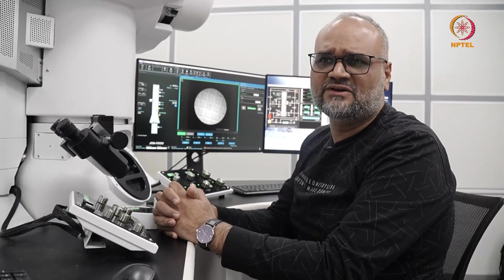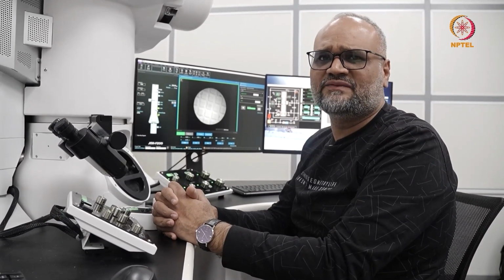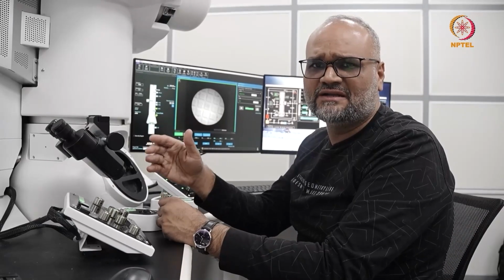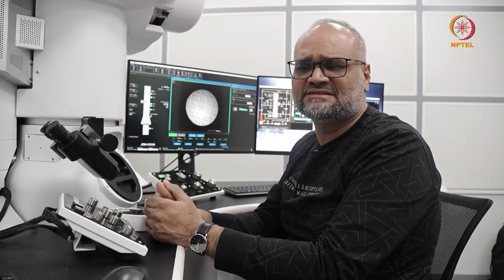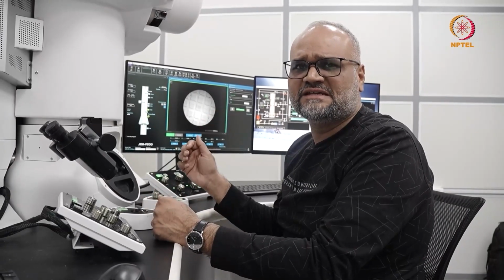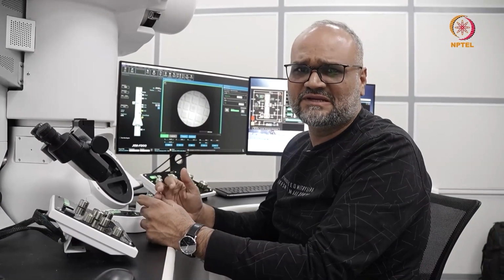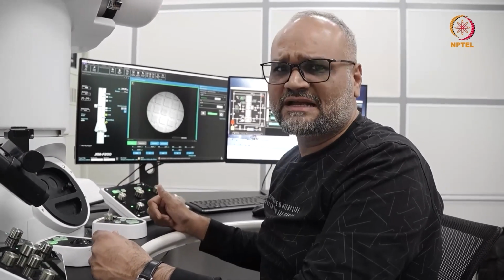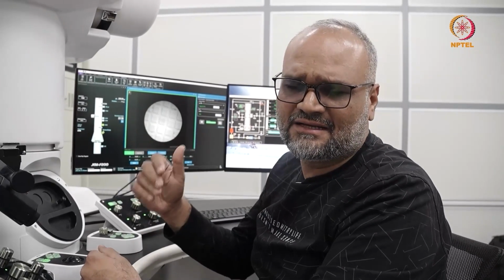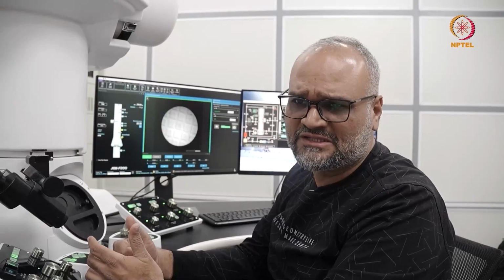I've shown you a few videos where tilting is done. You have to identify the direction of your X tilt and Y tilt, or alpha tilt and beta tilt. Orient your crystal into a low index zone axis, and then go to the amorphous area and start correcting for objective astigmatism. Also, before you do the objective stigmatism correction, you have something called the HT wobble correction, or in the Thermo Fisher microscopes, you call it the rotation center alignment. You also have the voltage centering and current centering on other instruments as well.